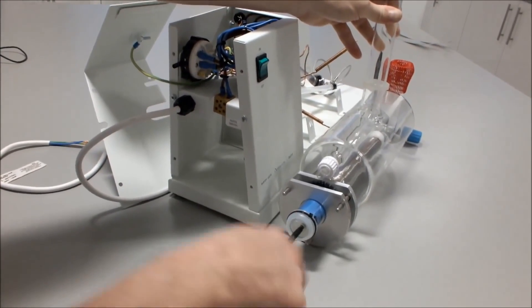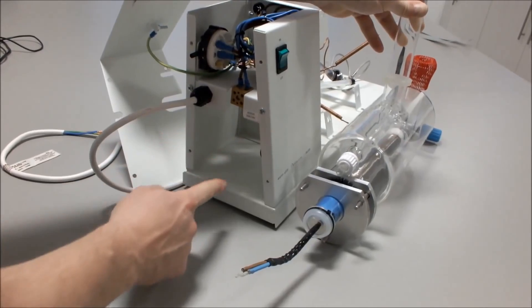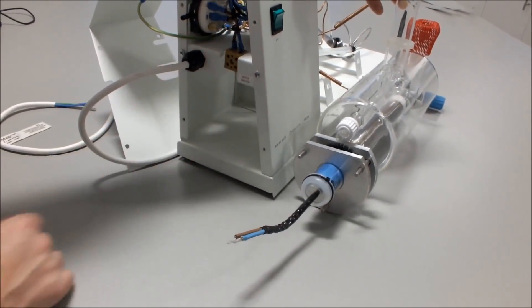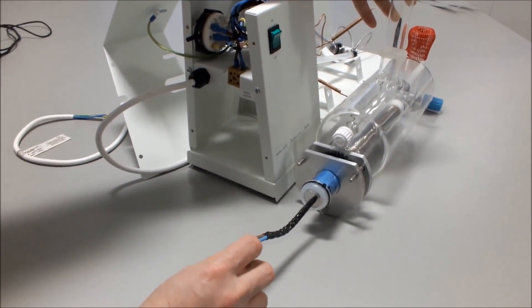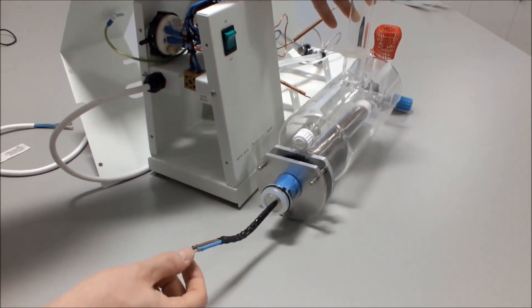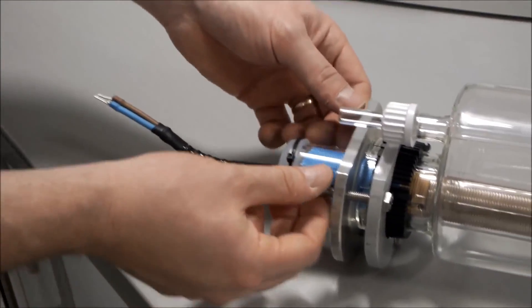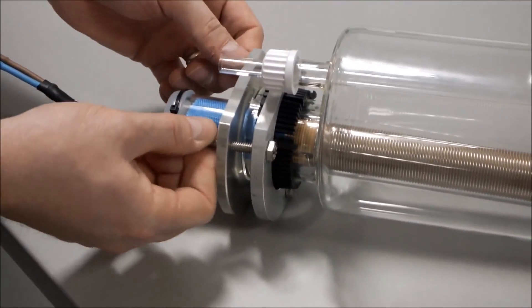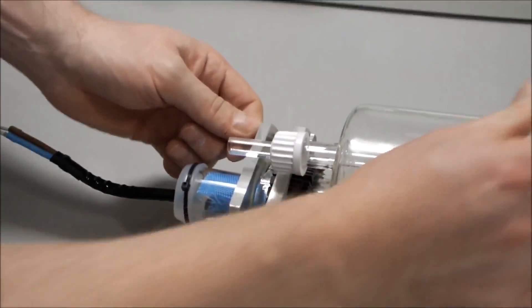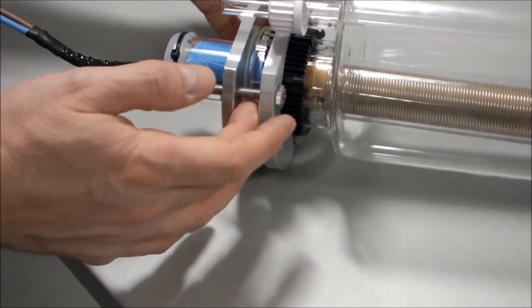You must make sure that brown is on the left and blue is on the right, so when you slide the heater in, brown is on the left and blue is on the right and they fit exactly into the terminal block. If it is the opposite way, simply slacken off and turn the heater around. When your heater cables are aligned properly, tighten up the three screws evenly. Do not over-tighten or you could crack the heater or the glass.